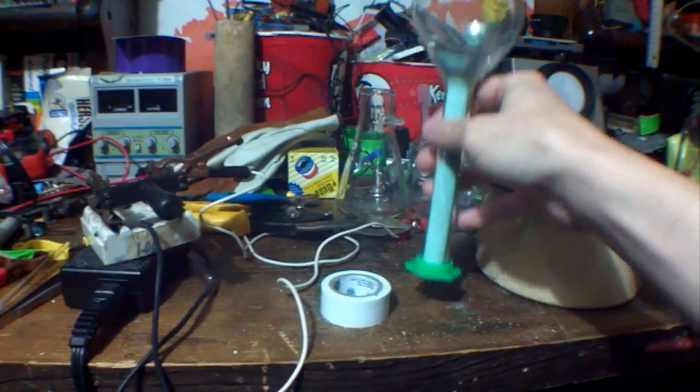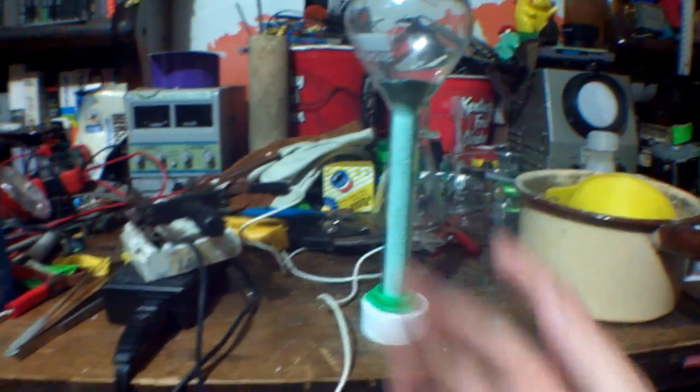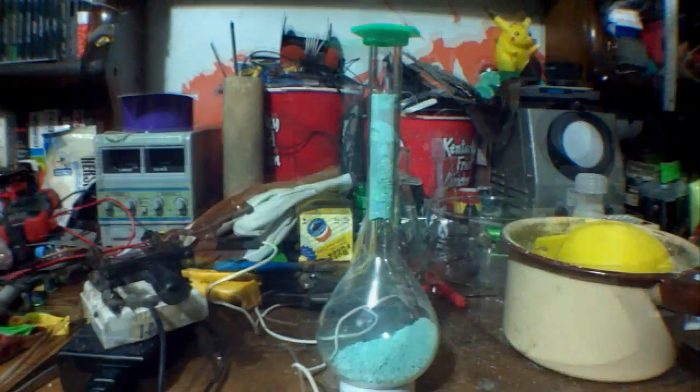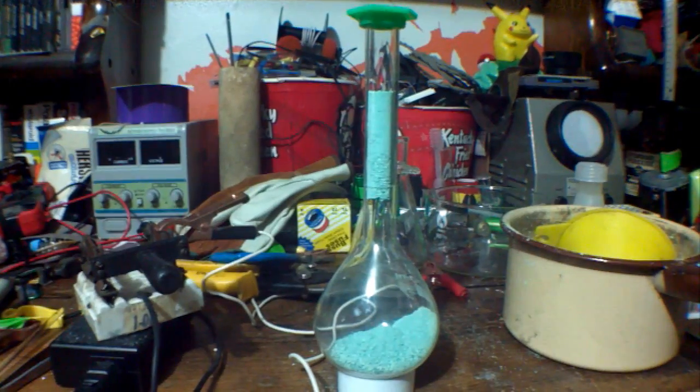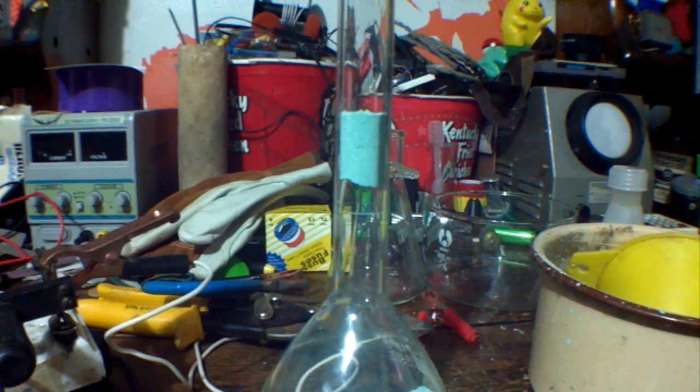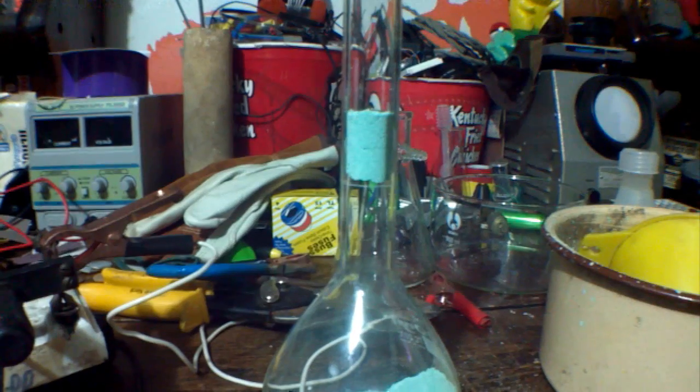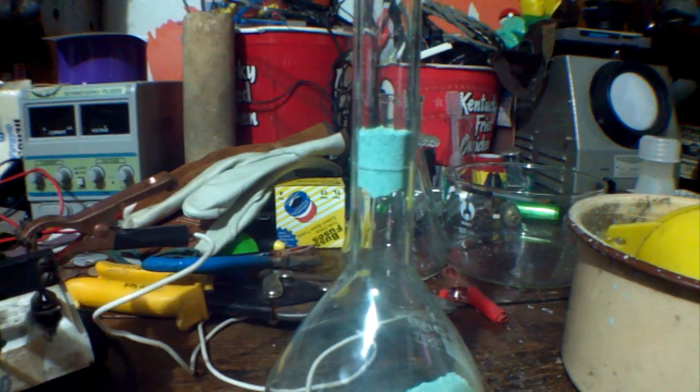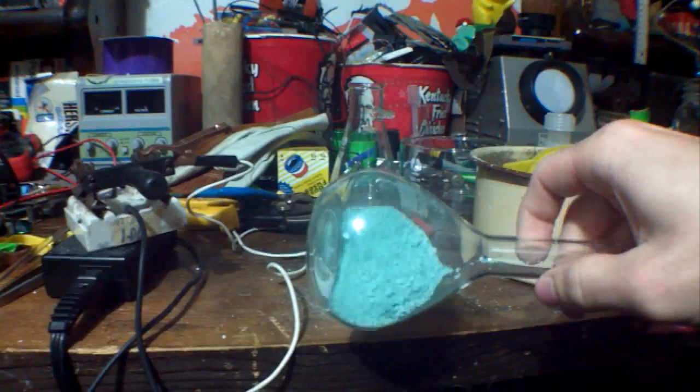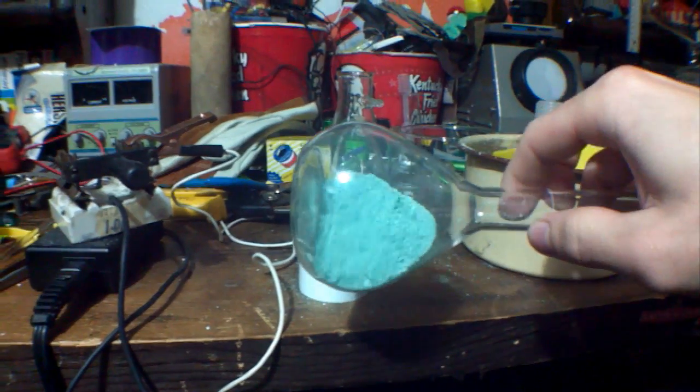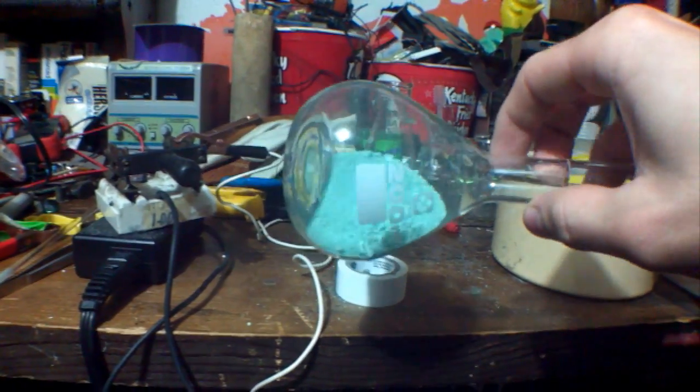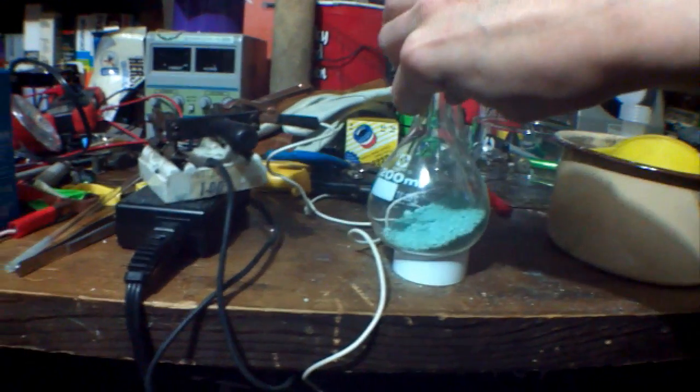Turn it upside down and pat it down to make sure it's all kind of stuck together. That's kind of cool. Then you flip it over—there you go. It's kind of fun. By spinning it like that, you also refine it even more, turning it into smaller and smaller pebbles—little fractures of copper hydroxide. Well, there you go.